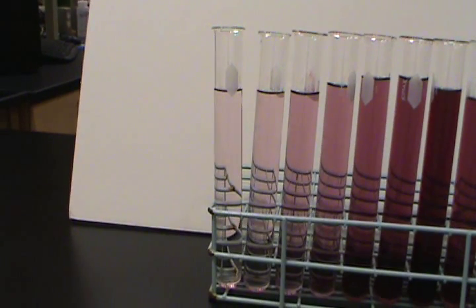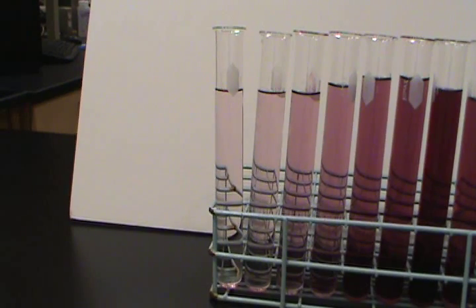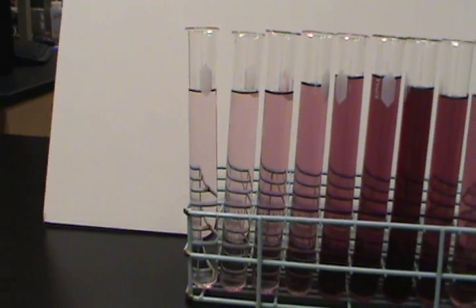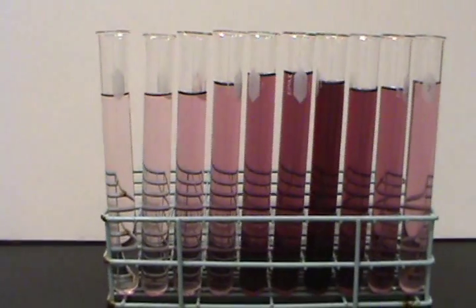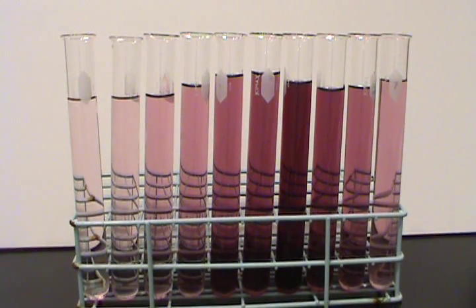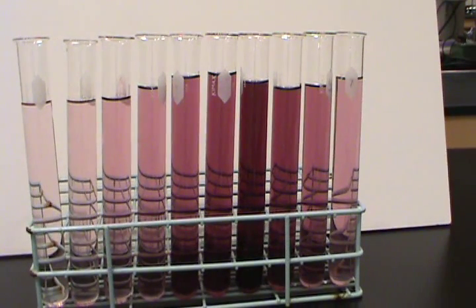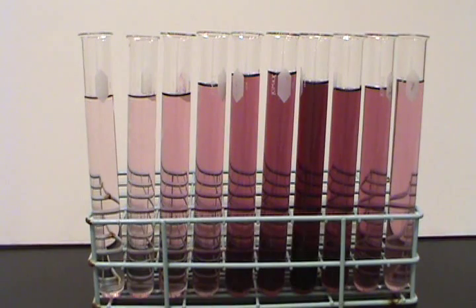So you can see that as we start over here with a very small amount of SSA, we don't get much color. But as we increase the amount of SSA, the relative amount of SSA, across this series of samples, the color gets darker until we get to a certain point, at which point the color starts to fade again, as now the amount of iron that's present gets to be too small to react fully and form the desired colored product.